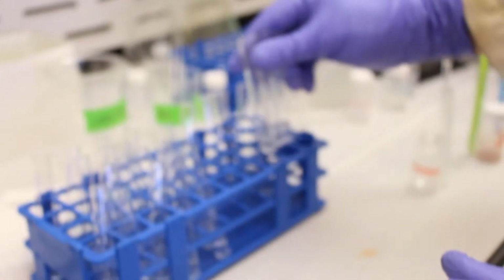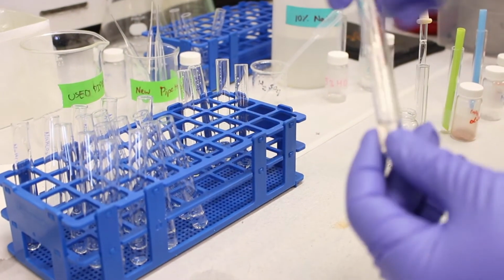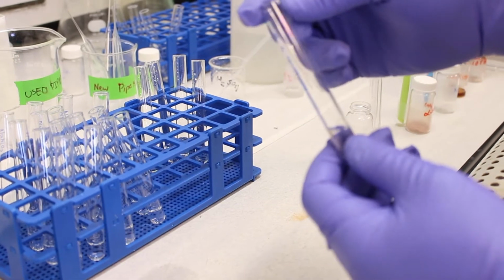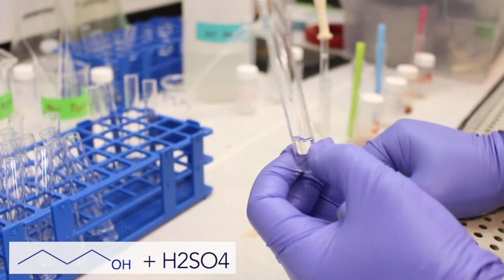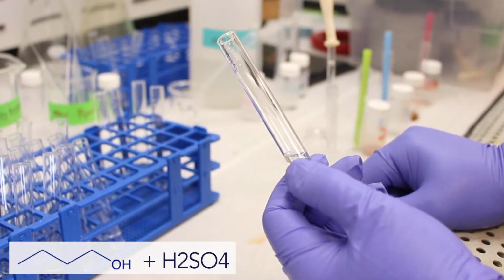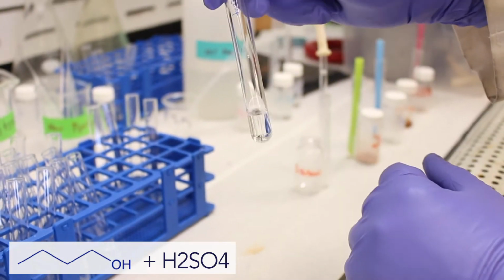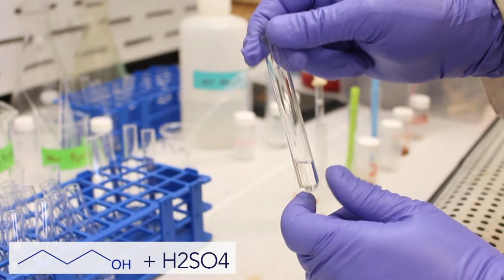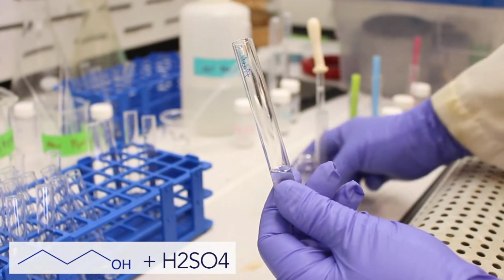Okay, so we'll place these to the side. But the final solvent we're going to use is concentrated sulfuric acid. Now, concentrated sulfuric acid is much like a chemical baseball bat. What it does is it ionizes even inert functional groups or even neutral functional groups such as the alcohol. Because the acid is so concentrated, it can even protonate the OH group, which makes it charged, and if it's charged, it's more polar, and thus it should be soluble in water.